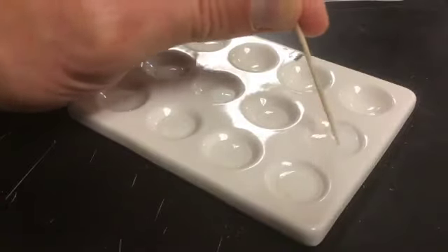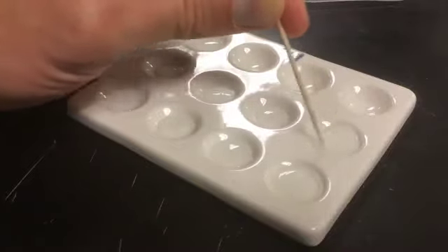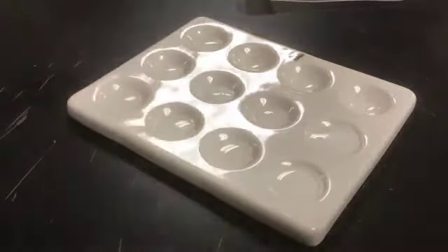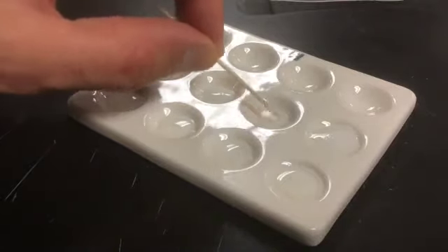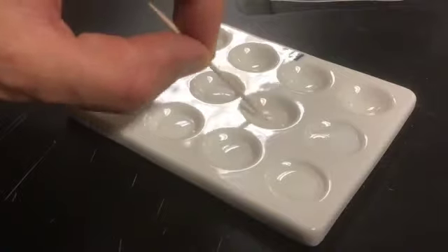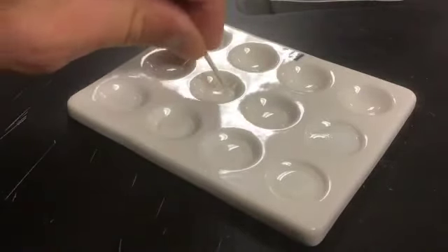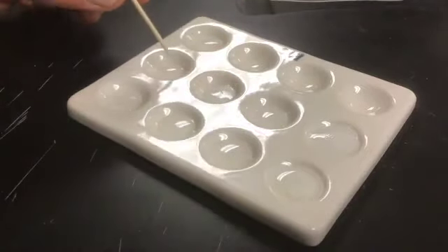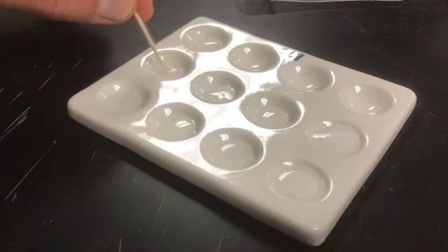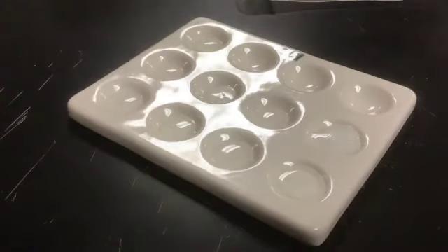Now I need to stir the milk and the Lactaid. But if I stir one of these wells, I need to stir all of them, because we need to be certain that it's not because of the stirring that we get a result. Now what I'm doing is using one end of a toothpick to stir, and then I'll flip it over so I don't contaminate my solutions, and I'll stir in one of the other wells.